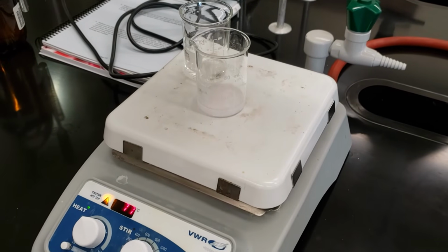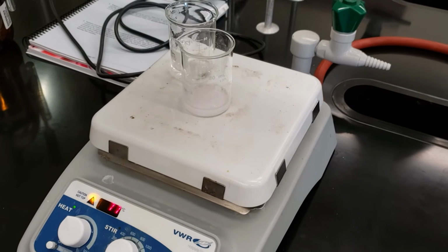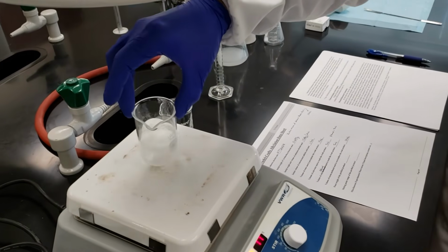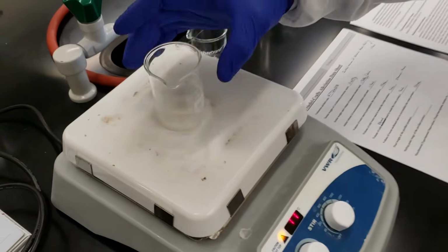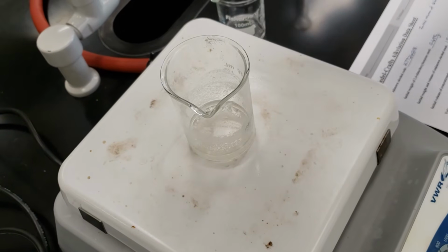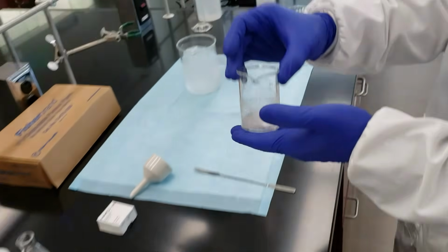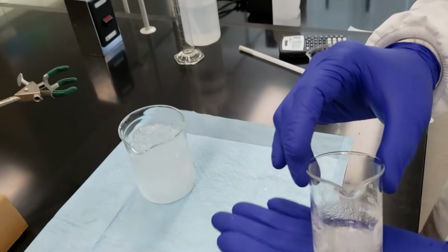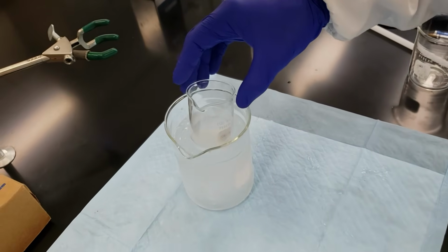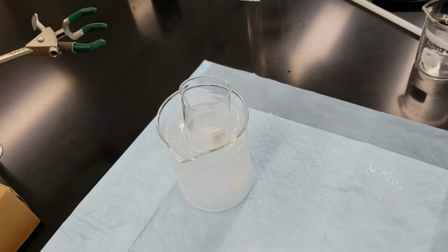We're going to let it sit on the hot plate for a little while to see if we can't get most of those crystals to dissolve. So we've continued to heat our crystals and our methanol, and as predicted, we didn't get all of our crystals into solution, but that's okay. We're going to get most of our impurities to dissolve, and then we're going to go ahead and take this over to our ice bath. It's warm to the touch, but not hot, so we can go ahead and set this in carefully. We're going to give that a couple of minutes to precipitate, and then we'll collect it on our Buechner funnel.